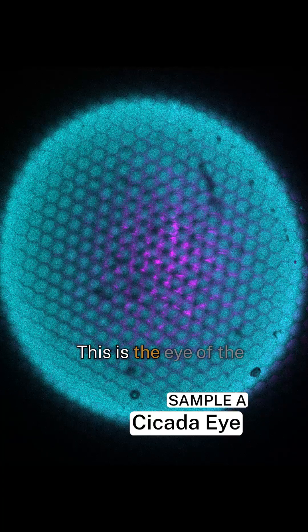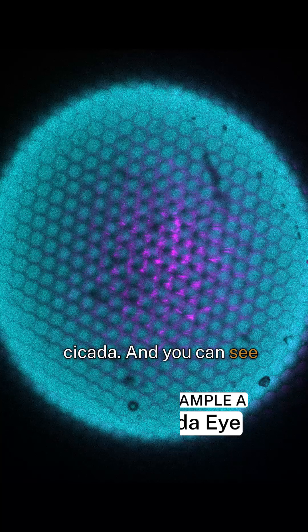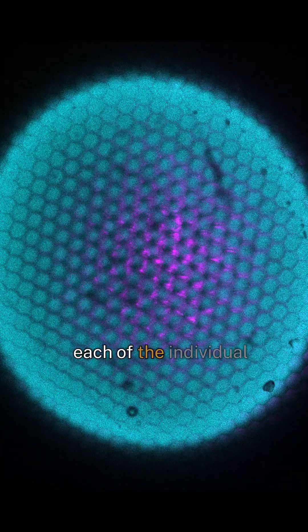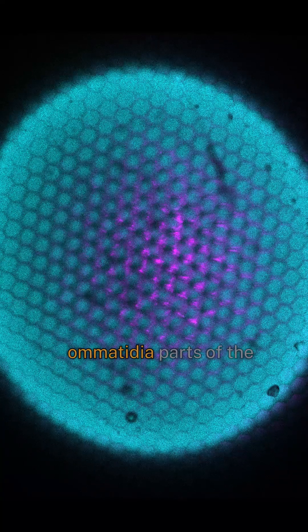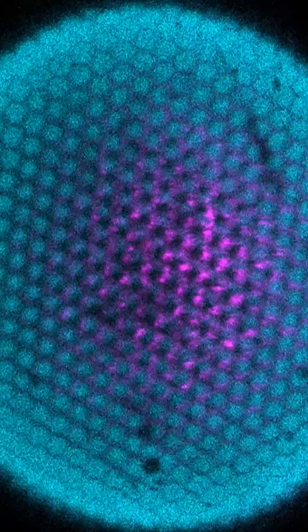Here we have the eye of the cicada, and you can see each of the individual ommatidia — parts of the compound eye of the insect.